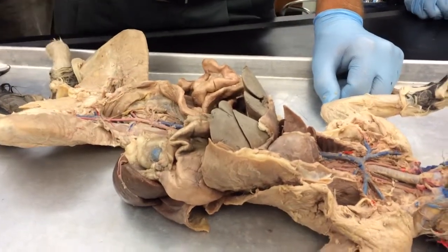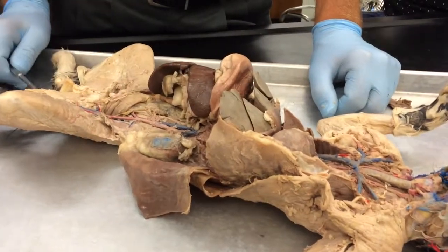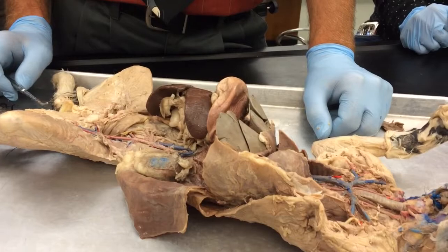Is there anything on the cat that I missed? I think you got everything. Okay. See how easy?